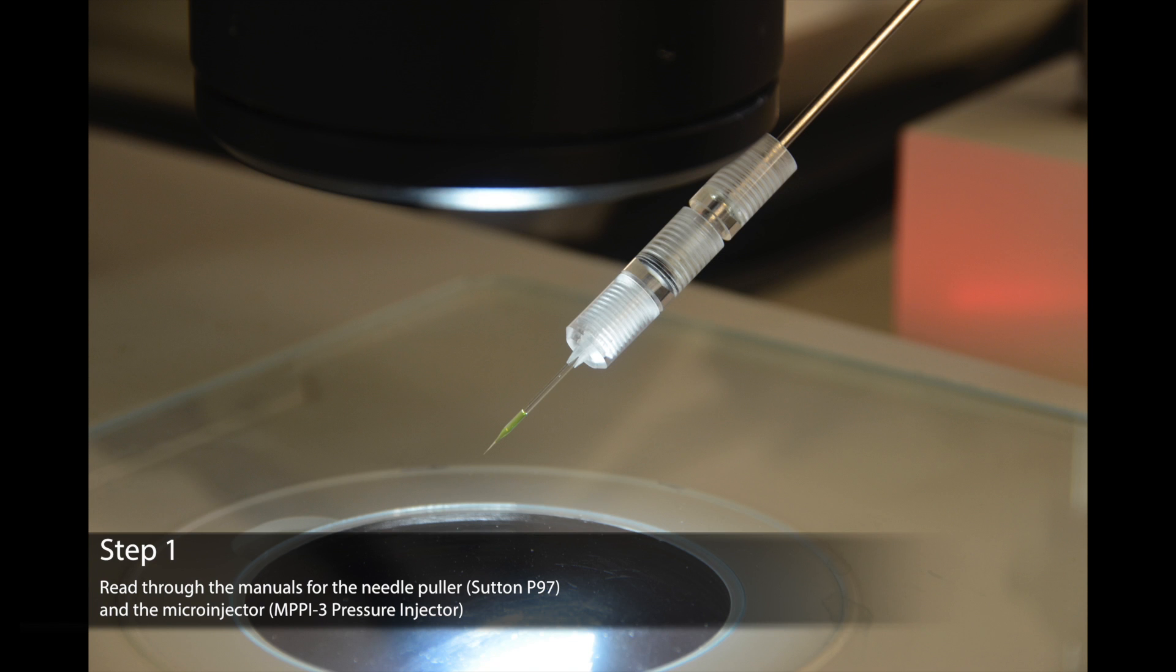Before beginning the microinjection protocol, please read through the manuals for the needle puller and the microinjector.